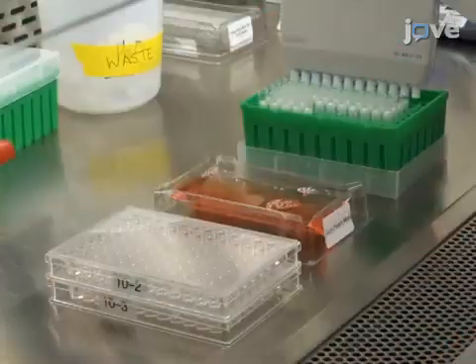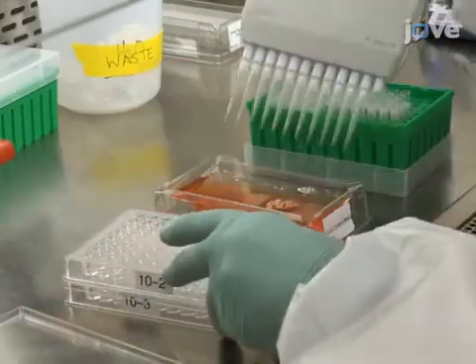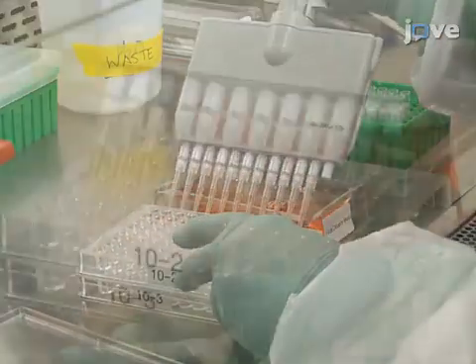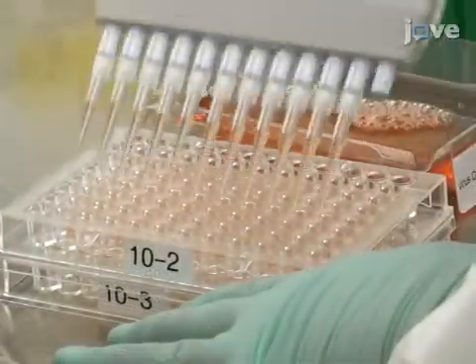Using two micro-titer plates, add 100 microliters of virus diluent to all wells except column 1 of the 96-well micro-titer plate.